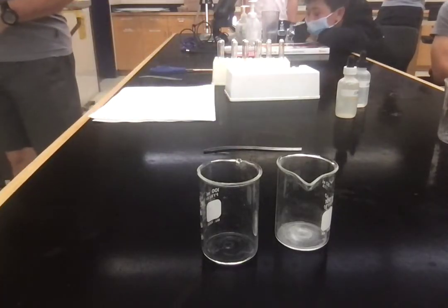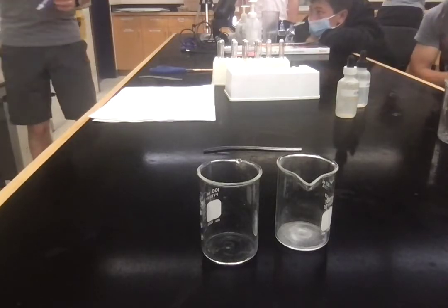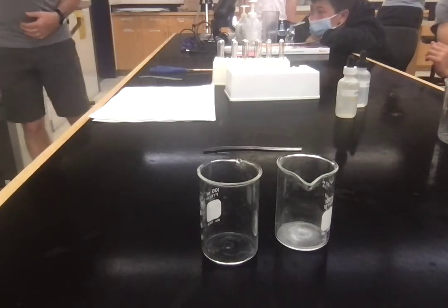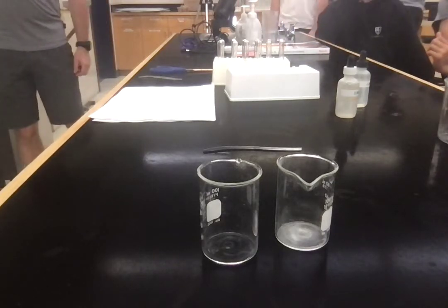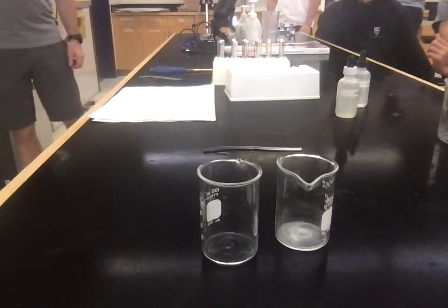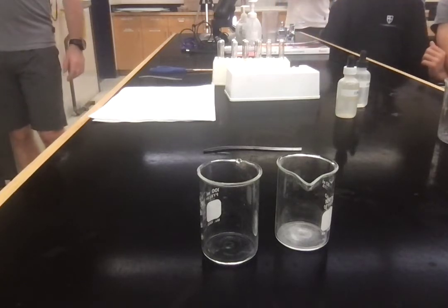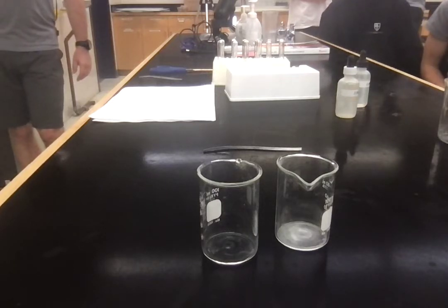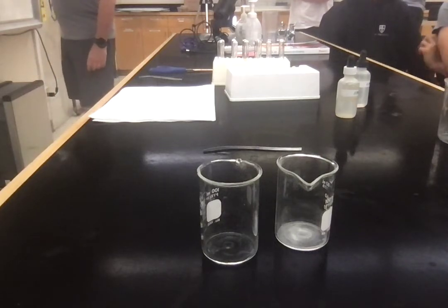So, what would the reaction be? This is going back to chemistry. What are the possibilities here? Like fizz. Single replacement? Okay, what's the magnesium going to replace? Cl. Does this gain electrons or lose electrons when it reacts? It's a metal. Loses electrons. So this can lose an electron, this can gain an electron. So which one's going to replace? Okay, the H. So we've got an Mg and a Cl, and then we've got an H over here.